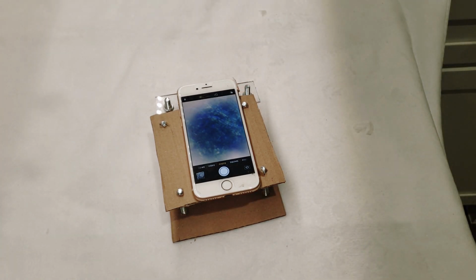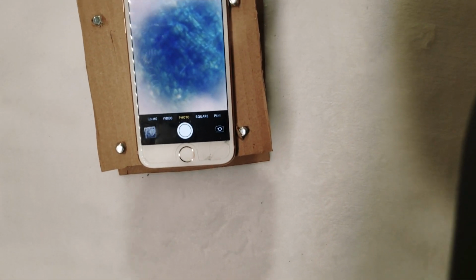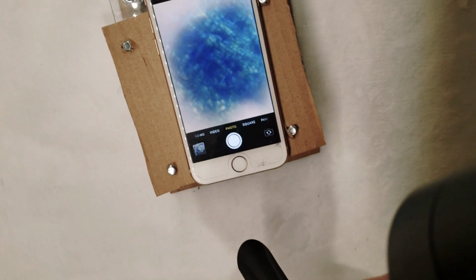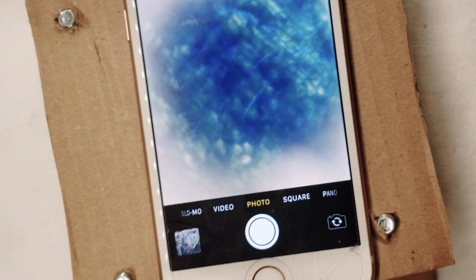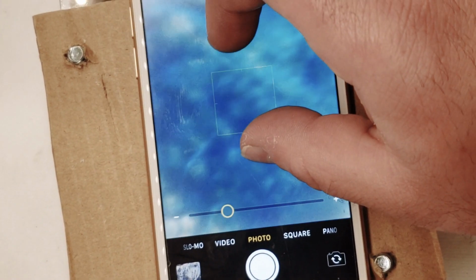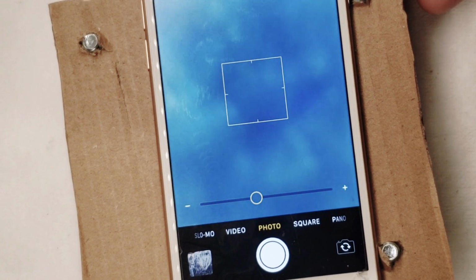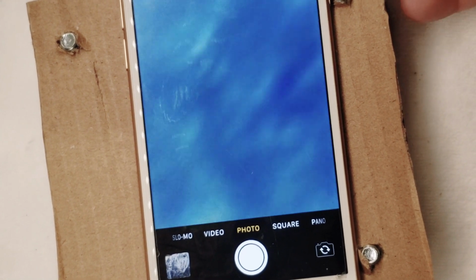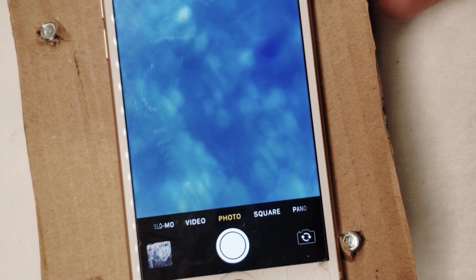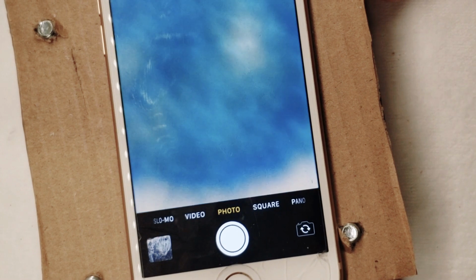There we go. We've got a decent focus. I'm going to bring you down in closer. We've got a decent focus on the cell walls there. You can zoom in. And actually, let me see if I can zoom in on here as well. Whoops, I really adjusted that. I don't know if that's in focus anymore. Yeah, you can see. We can move this around even. You can see some of the cell walls.